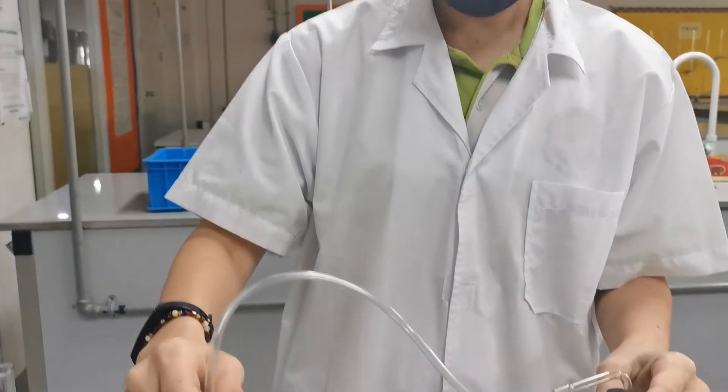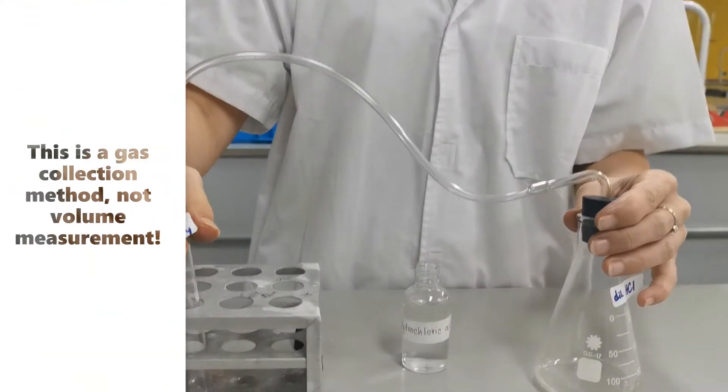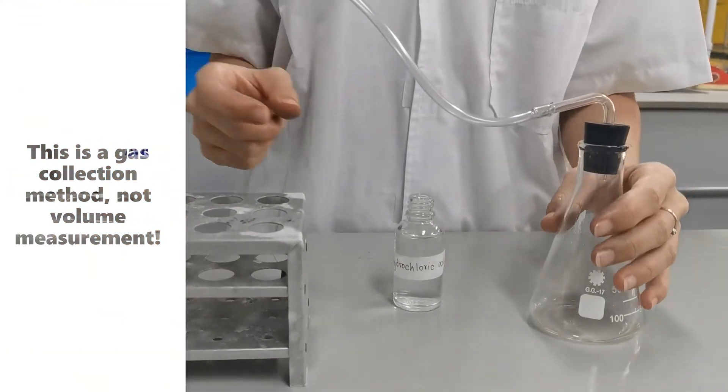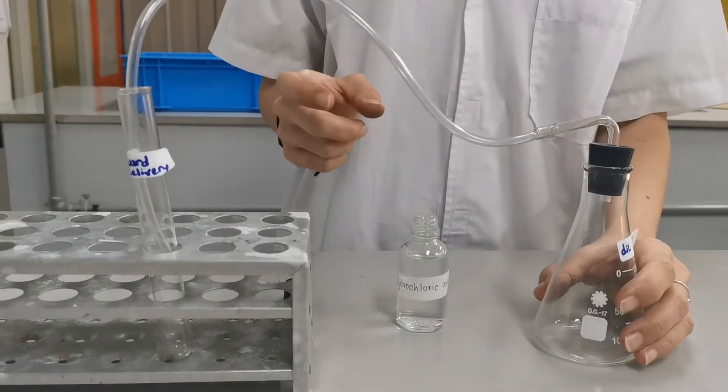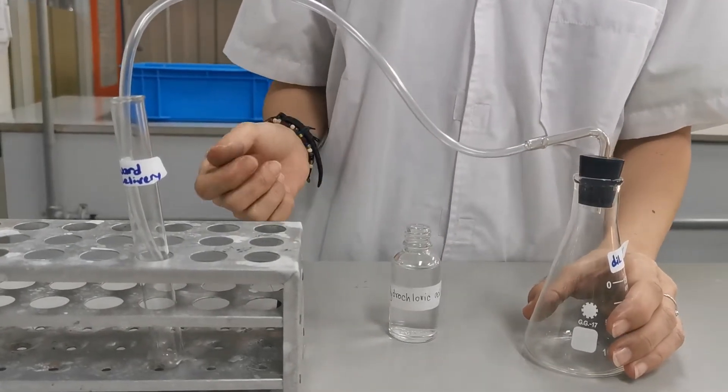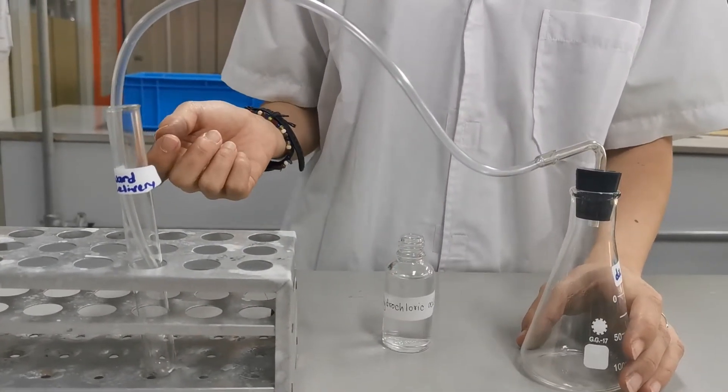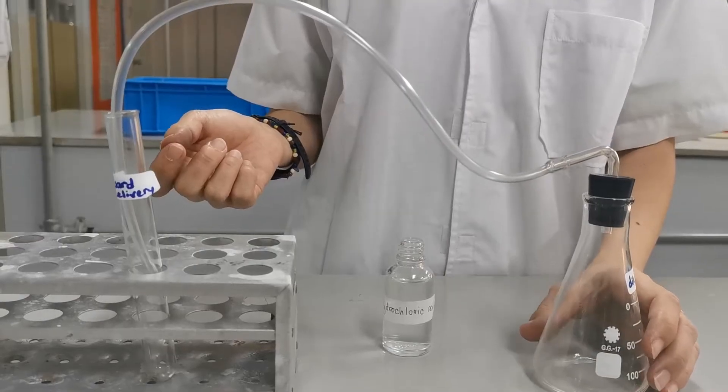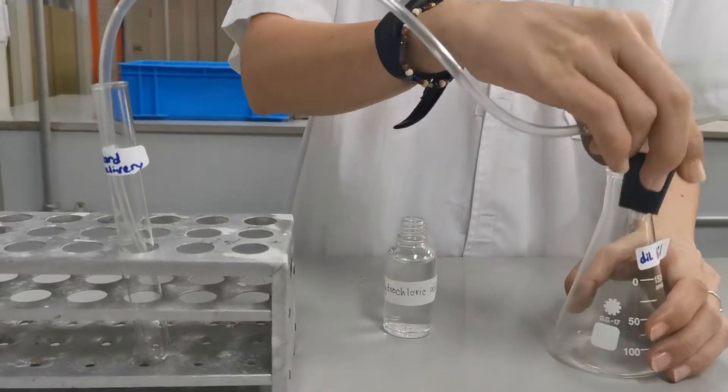But this method is not for gas volume measurement. It's only to collect your gas and later on test the gas using chemical reaction. So let's get on with the experiment.